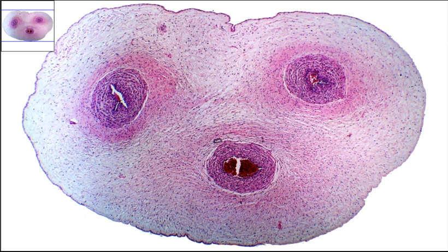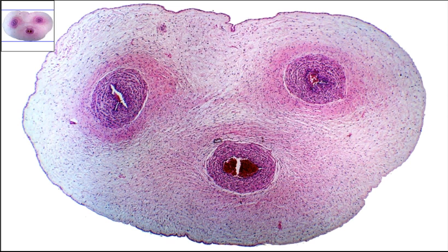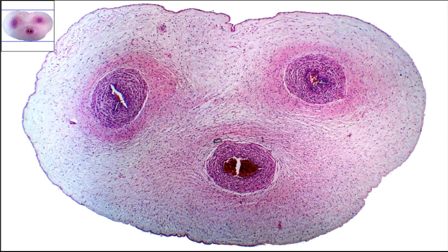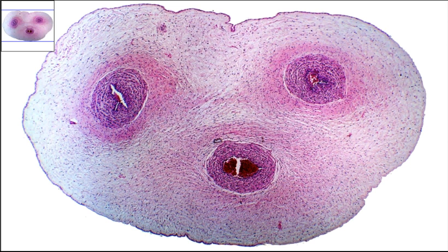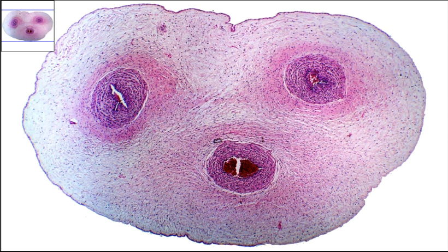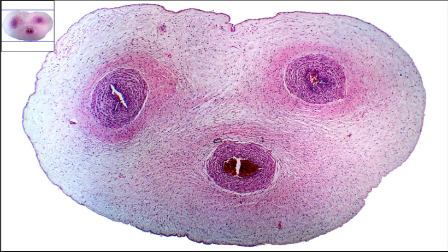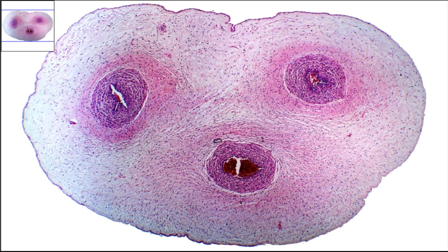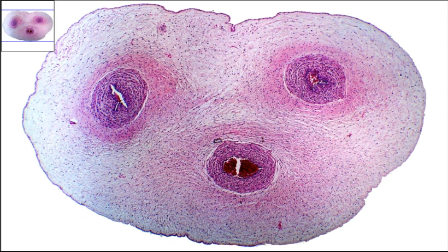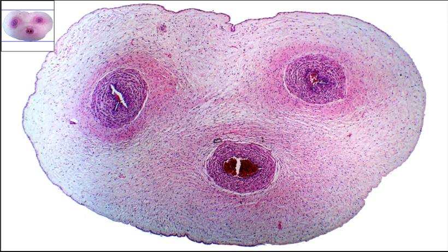This slide is of an umbilical cord. The magnification is currently about 20x total magnification. The reason I say about is this image you see is actually four separate images taken at 40x total magnification. The images were then combined to make the one you're seeing currently, so I'm saying about 20x total magnification.